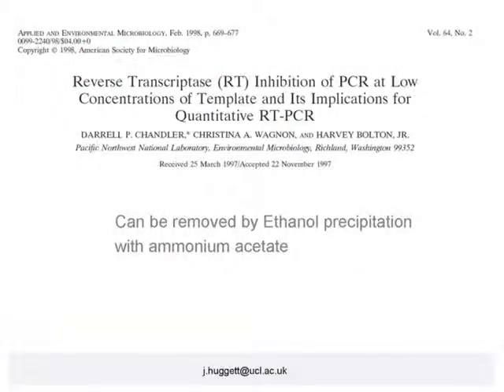And while those examples are demonstrating the effect of an inhibitor that is within the sample from its environment or from its source, the paper shown here demonstrates that even the reverse transcriptase remaining within an RT, which is generally remaining bound to the cDNA, will then have the effect of inhibiting PCR, particularly when at low concentrations of target. So, of course, this is particularly important if you're working with, for example, single cells or very small numbers of cells or laser capture samples, for example.